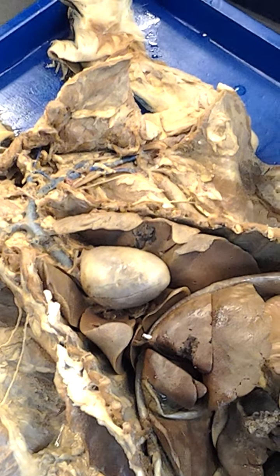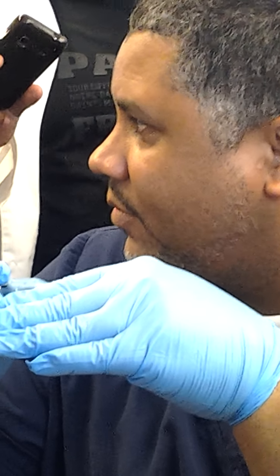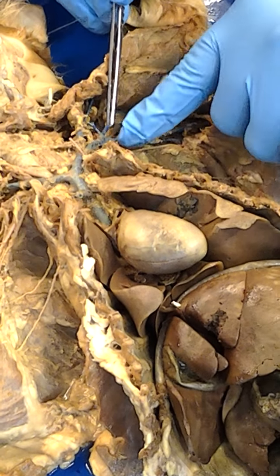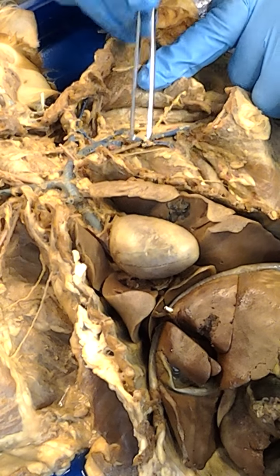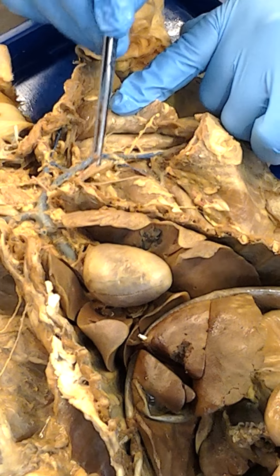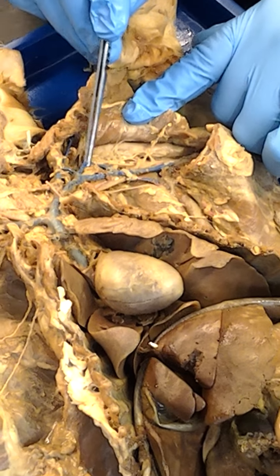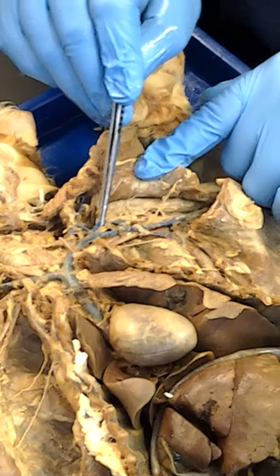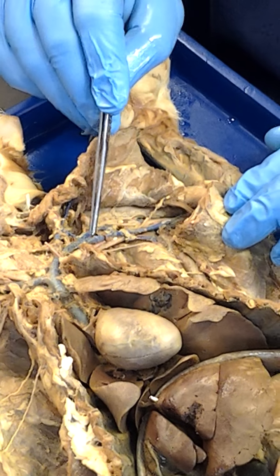Now, remember that the subclavian is formed when the axillary merges with that of the cephalic. Remember that? So if we look at the vein here, here's the subclavian. Notice that there are two blood vessels that are coming off here. One right here and one right here. So if this is heading towards the arm, which becomes the axillary, so these are the axillary, then what must this be? The cephalic. So this is the cephalic right here.